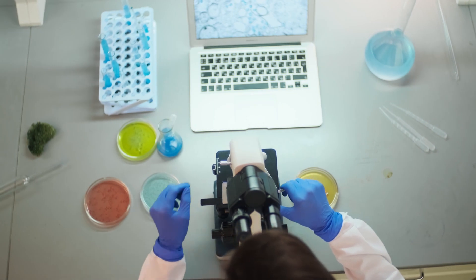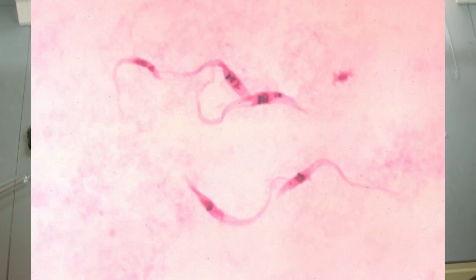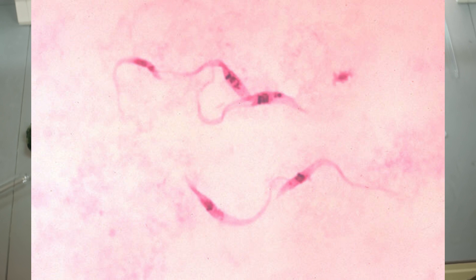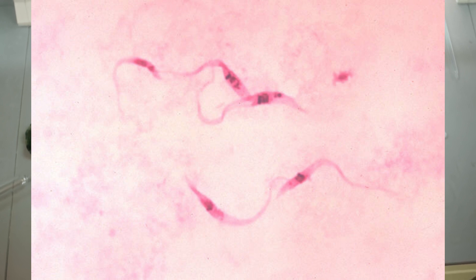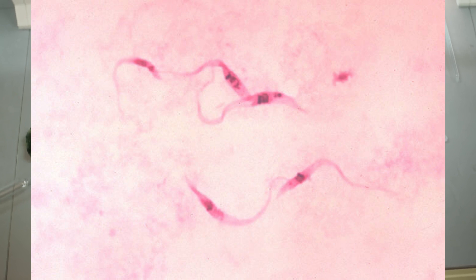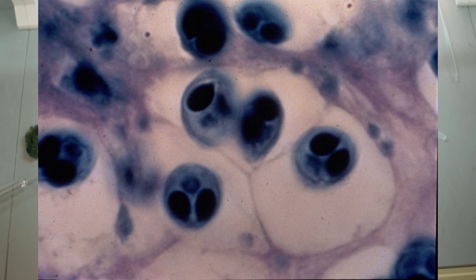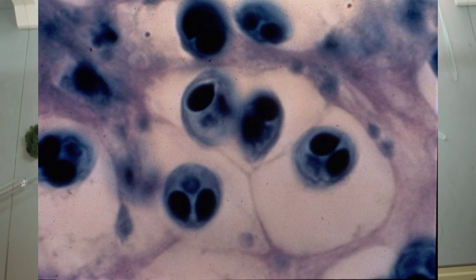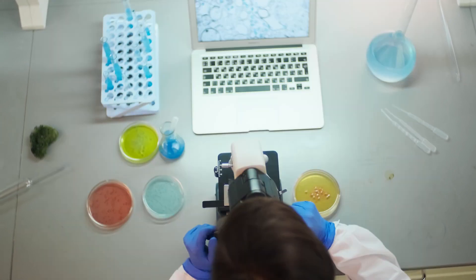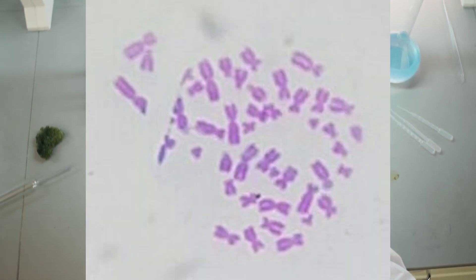Next are Romanowsky stains, used particularly for haematology — that is, the study of blood and blood sources like bone marrow. Think of taking a blood sample and smearing it over a slide. If you want to see what is in that blood, like parasites, this is a good way to go about it. They can also be useful to visualise chromosomal abnormalities.